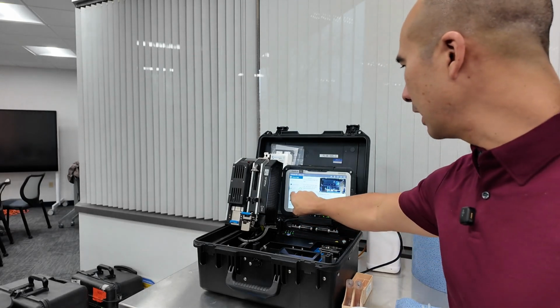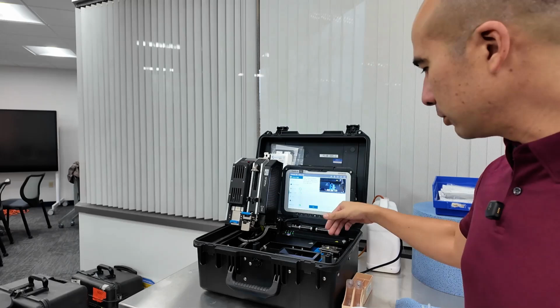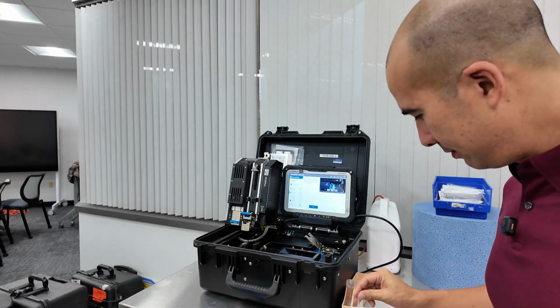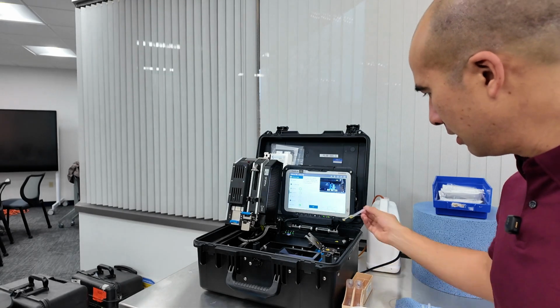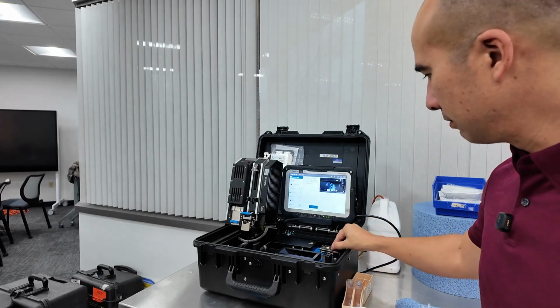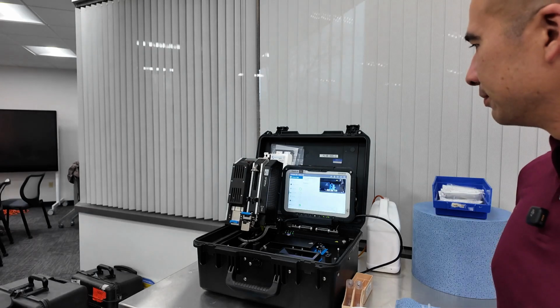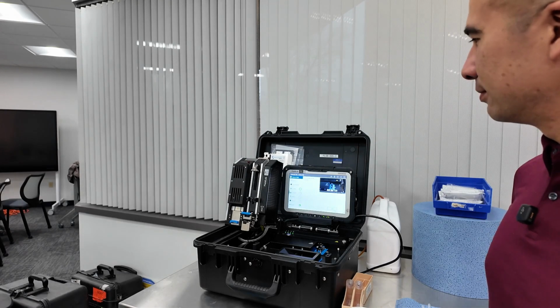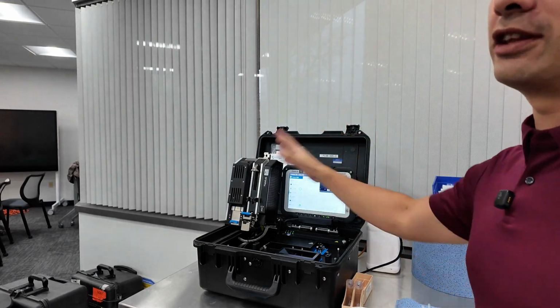Okay, in the meantime, chemistry looks like it's completed the background check. As a result, there was no fluid in there, so we can open up the cell. I'm going to take this little pipette again, do the same thing and put a little drop on here, and then close up the cell again. So put this in and then press start. All right, that's all completing. And again, in the meantime, we can go on to the next level of the analysis.